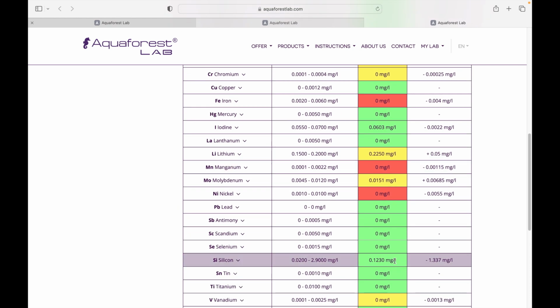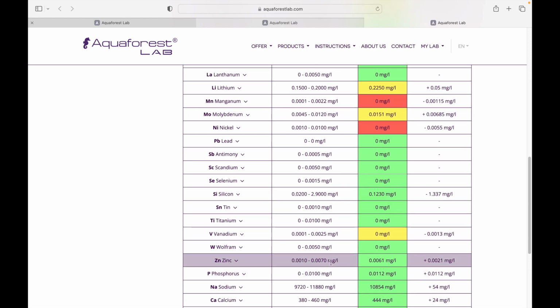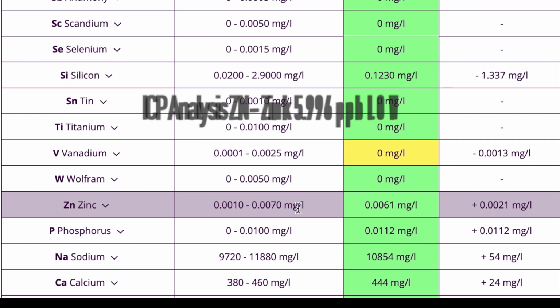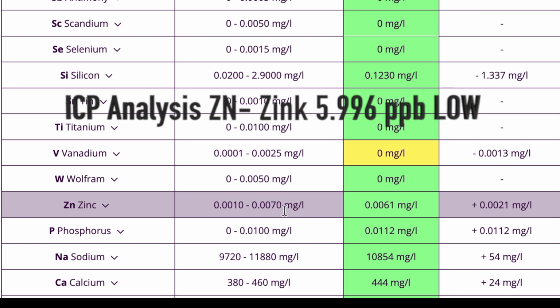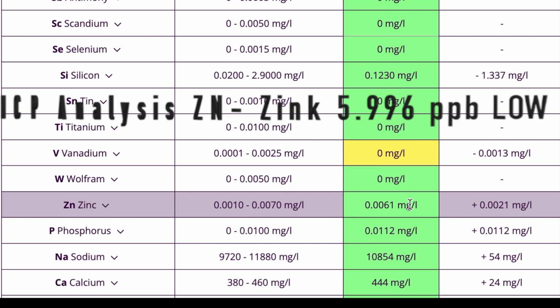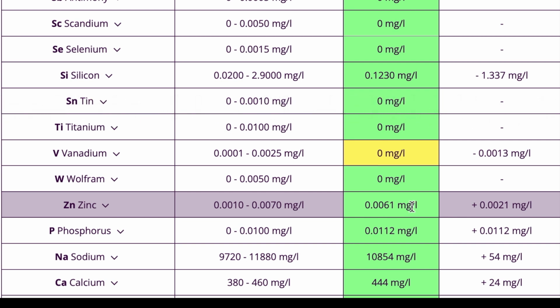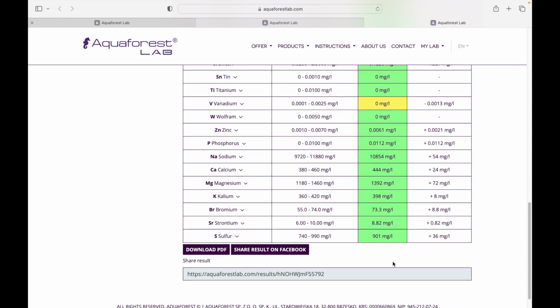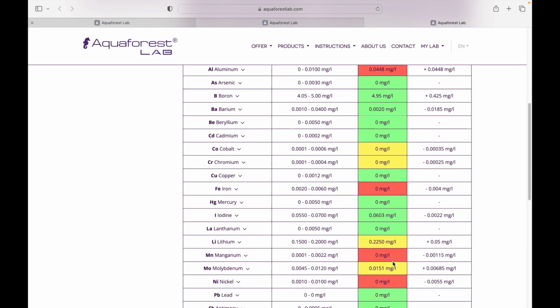Where's the next one here that raised my attention was zinc. So let's find zinc here. Zinc. Okay. Zinc was low on ICP Analysis, and zinc here is fine, actually. No problems. It's showing it slightly higher than ICP Analysis, but it's saying that there's no issue with zinc. Yeah, so there you go.